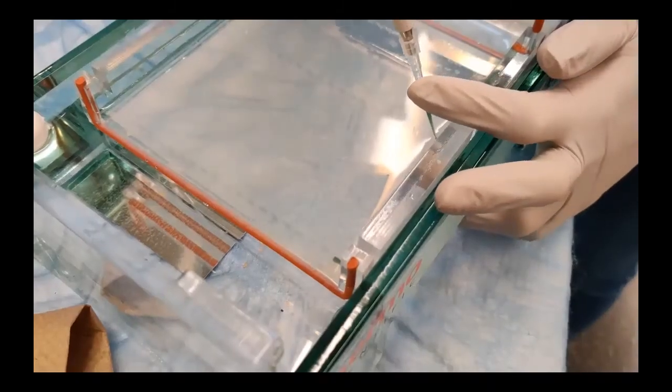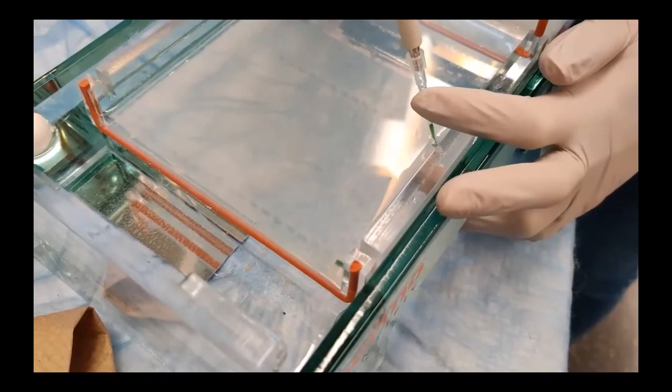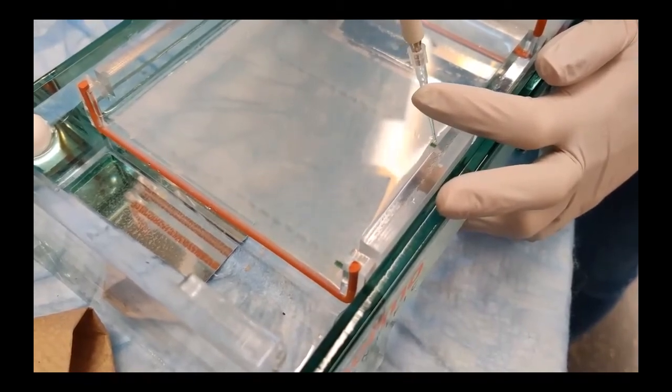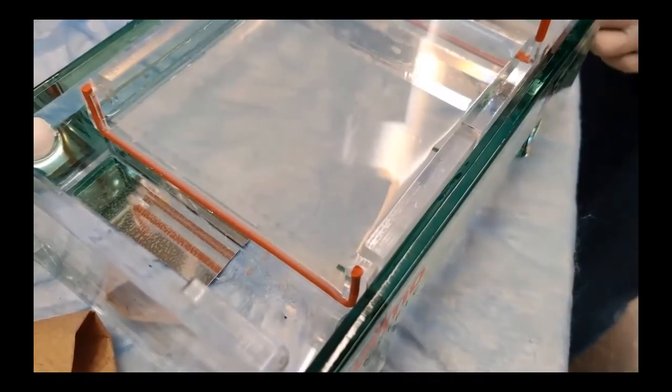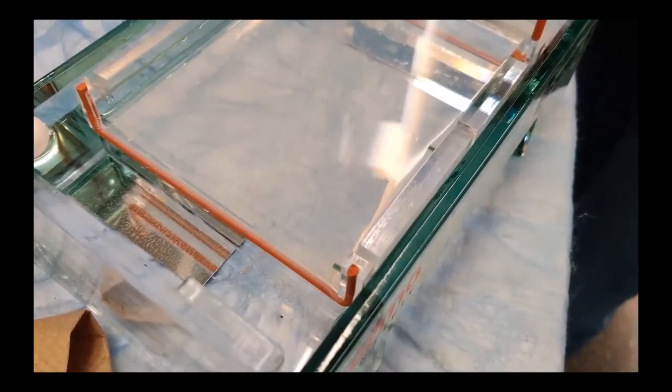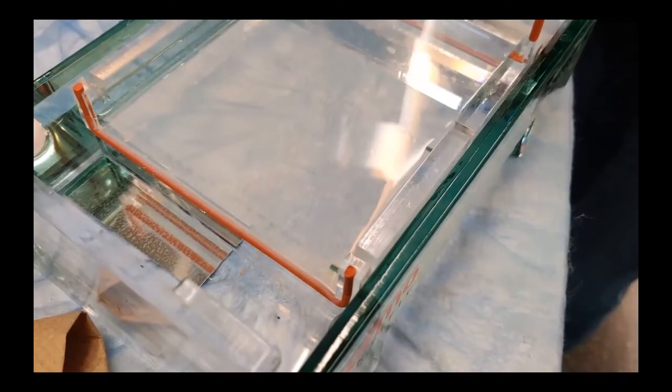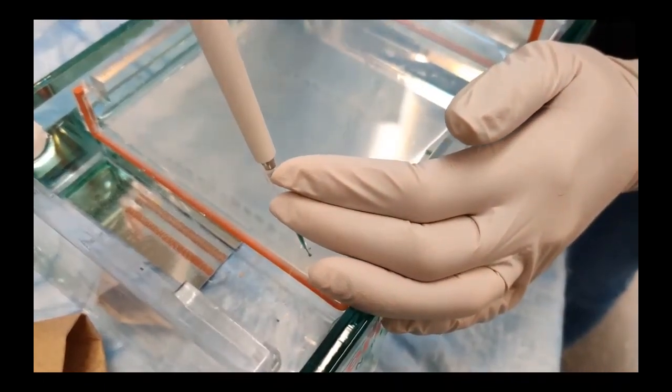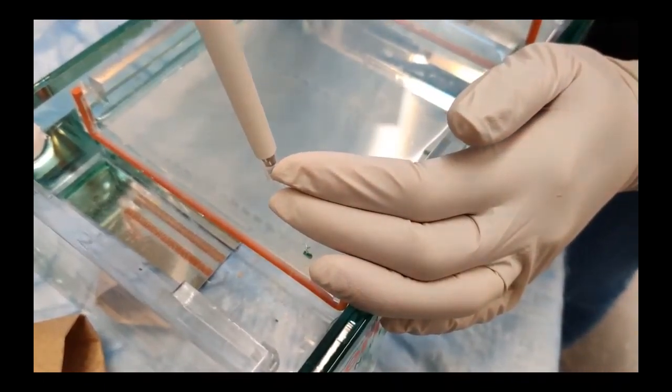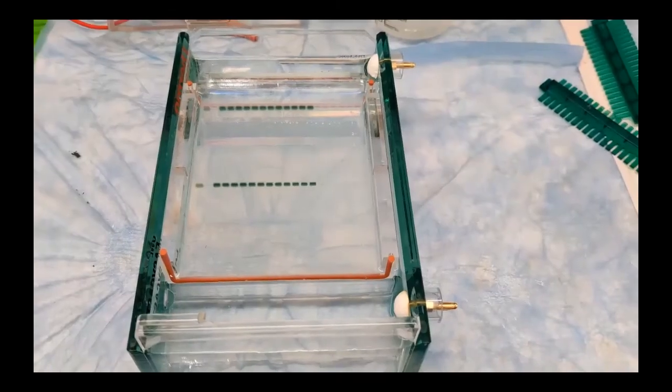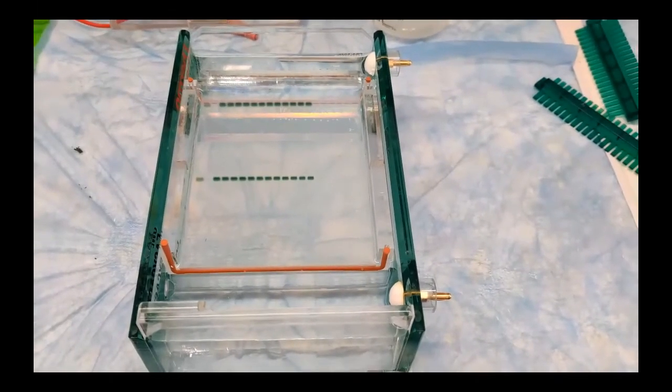Now to add our samples! Careful not to poke through the gel! After adding all the samples, we are ready to run!